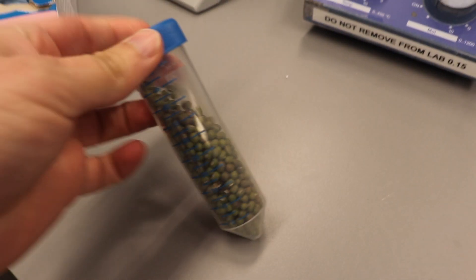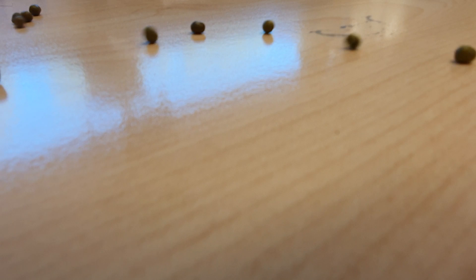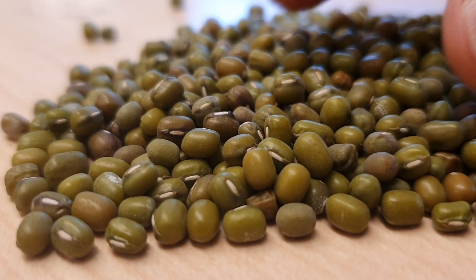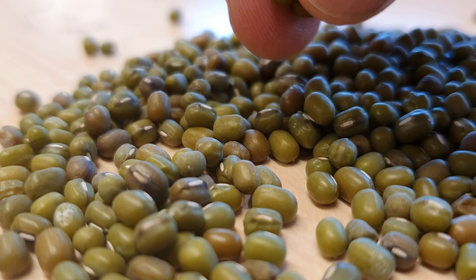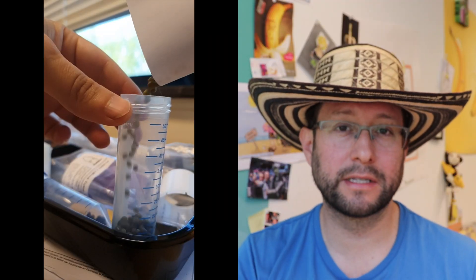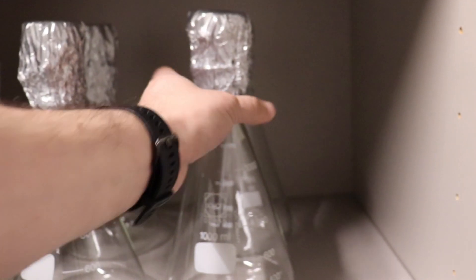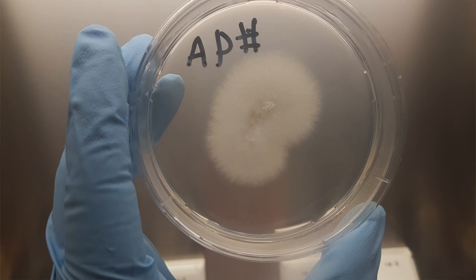So what do we need? First of all, and maybe the most important ingredient: the mung beans. These little green beans are also known as golden beans and are very common in Indonesia and many other parts of the world. You can find them in almost every supermarket and they work very well as the base for the broth media for sporulation. We are also going to need a one-liter measure, water, and a fresh plate with your favorite Fusarium.